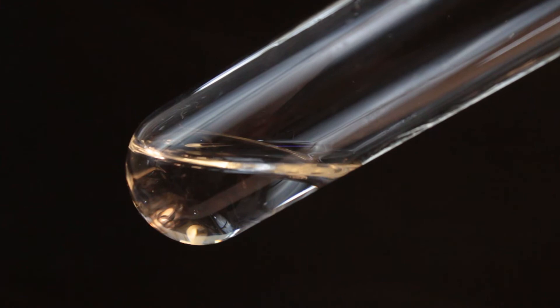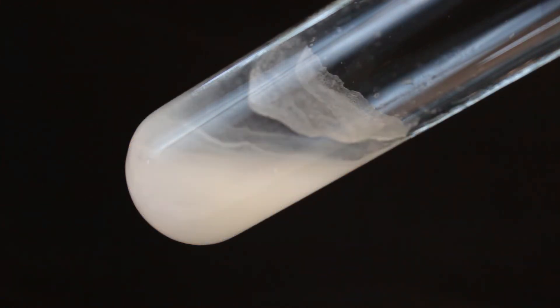Before heating it should look like that. And that's after heating.